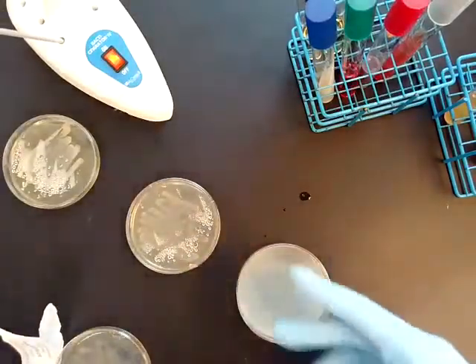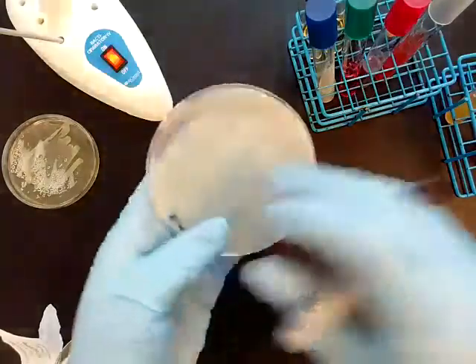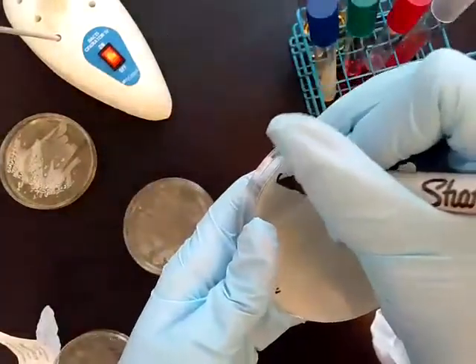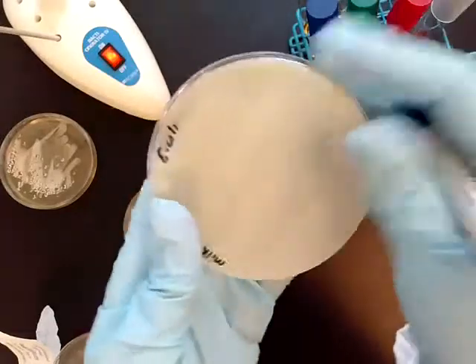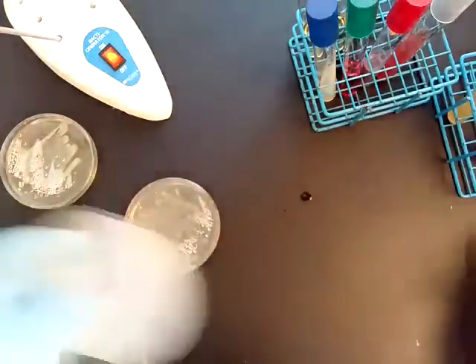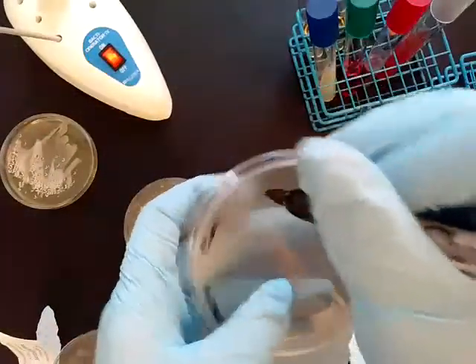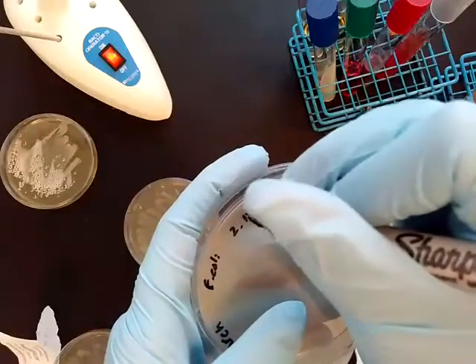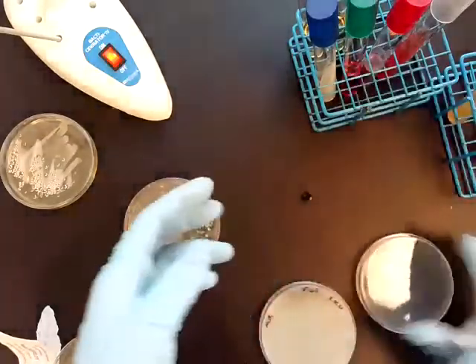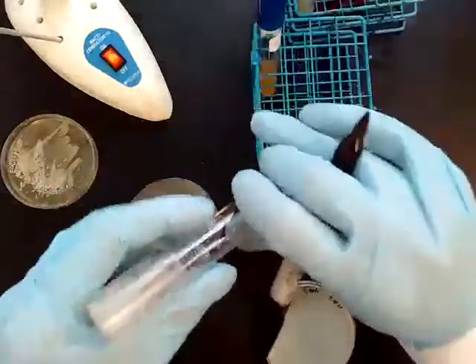For proper technique, I'm going to label the plates before inoculating. I'm going to put E. coli on all of these and write today's date. I'm also going to label my slant.